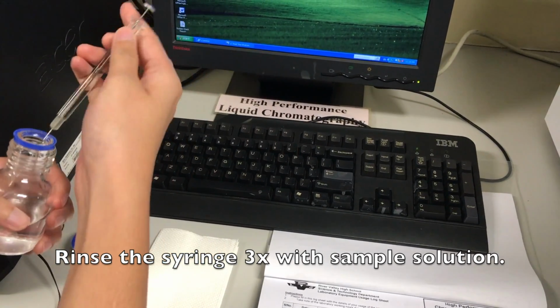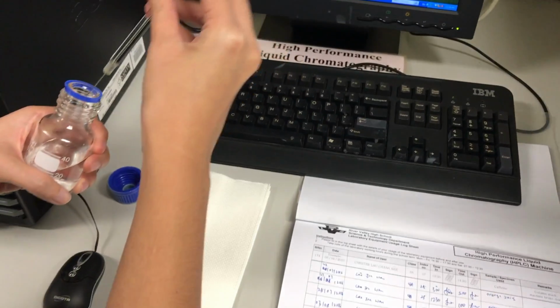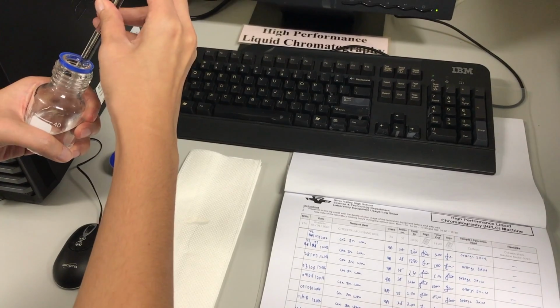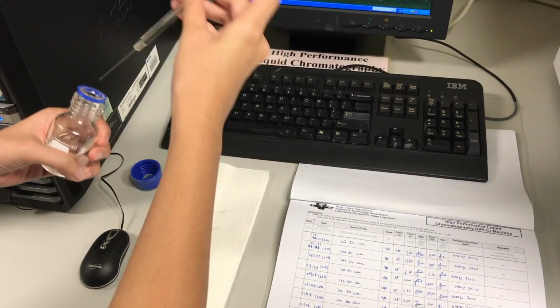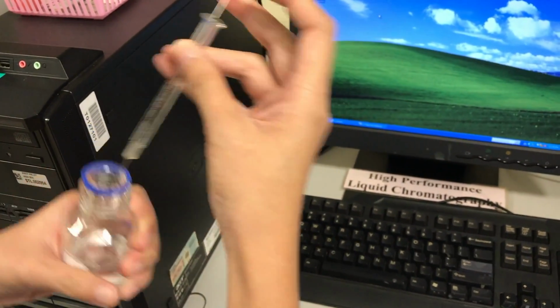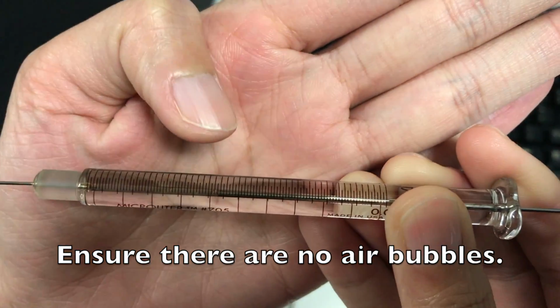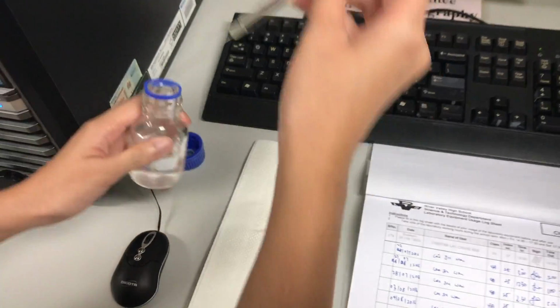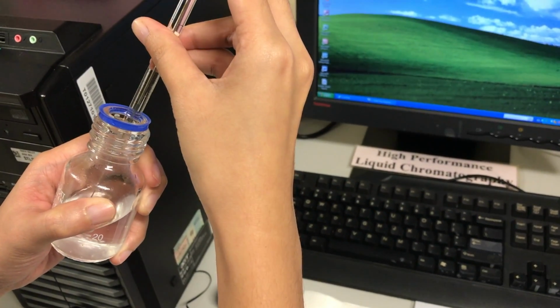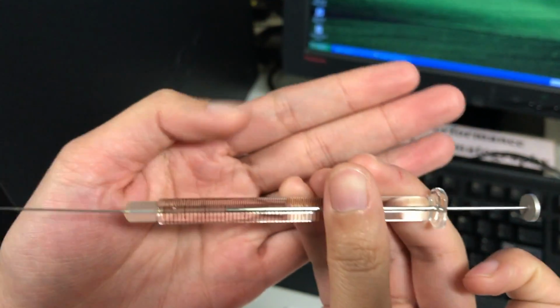Prepare the syringe by drawing 3 times from your sample. As our loop is only a 20 microliter loop, we only need 20 microliter of sample. So if there is an air bubble, discard, retake. Only inject the sample when there is no air bubble.